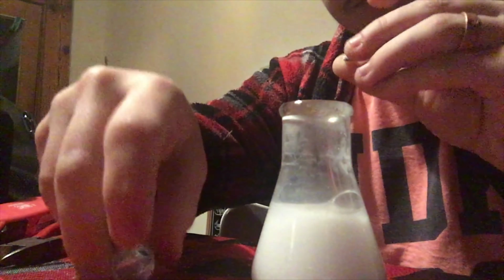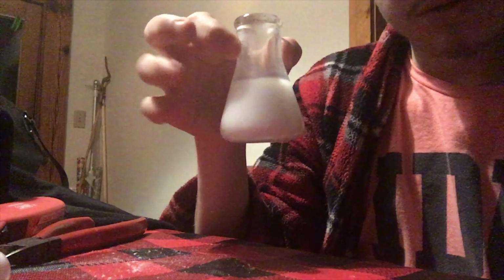Actually, I'm going to save one little piece for later, because we may do it with an acid reaction. So that is calcium. We've got ourselves now a lovely little solution. People are saying, why are you touching that? It's hot. It's actually not. It's just warm. I mean, it was hot to begin with. Now it just looks like milk, almost.